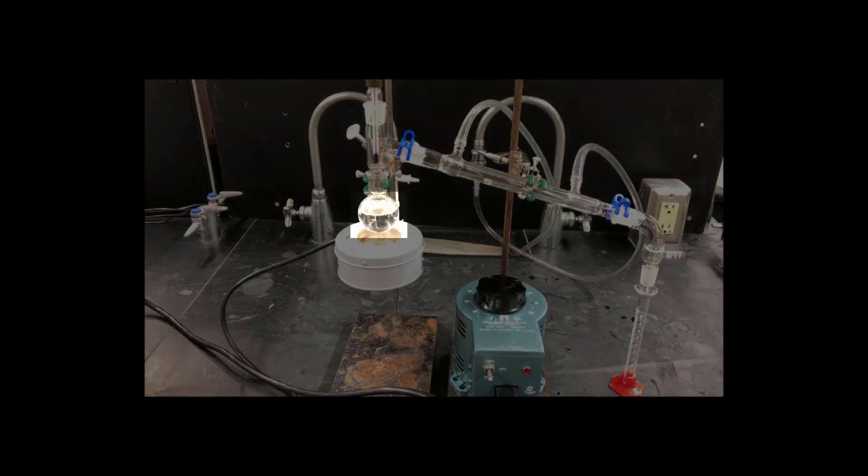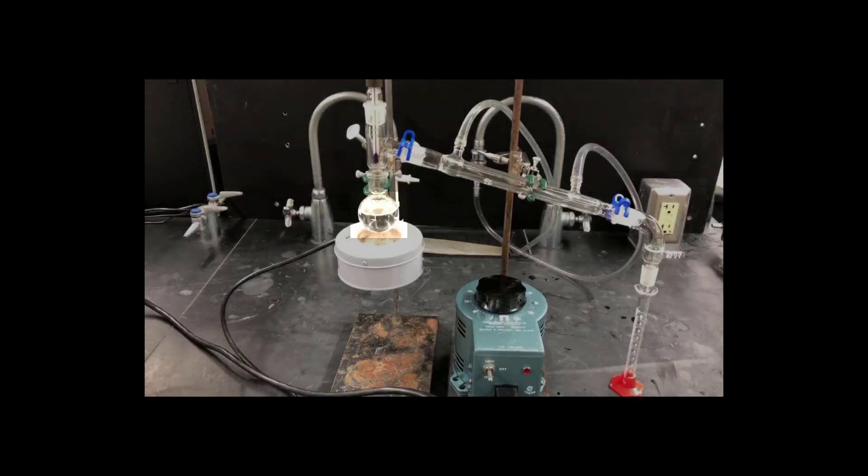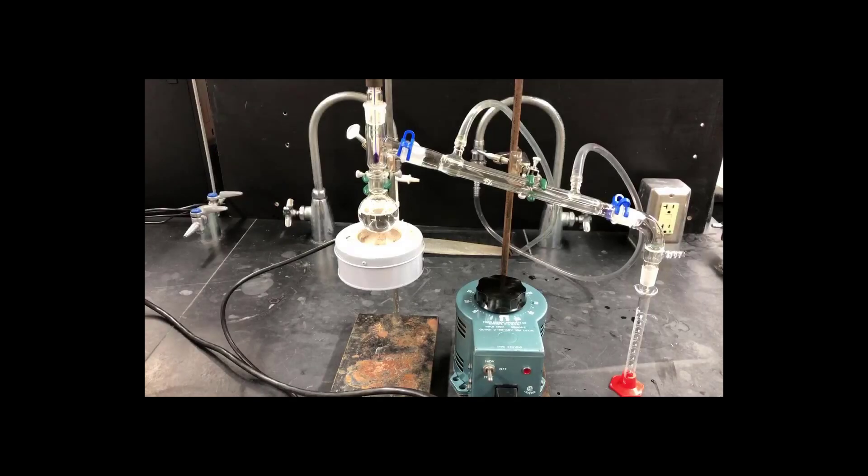The flask you distill something out of makes a big difference, and it should be about half full. However, the vessel you use to collect the distillate in could be just about anything. It really doesn't matter.